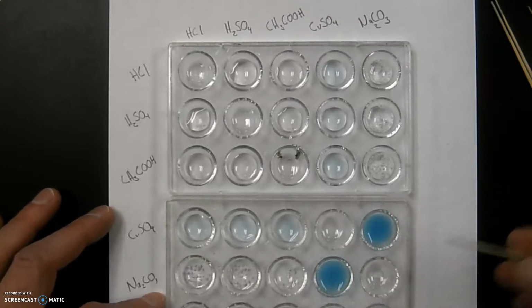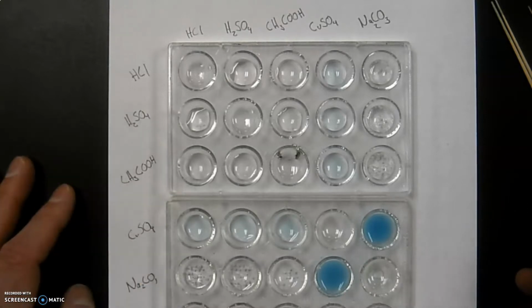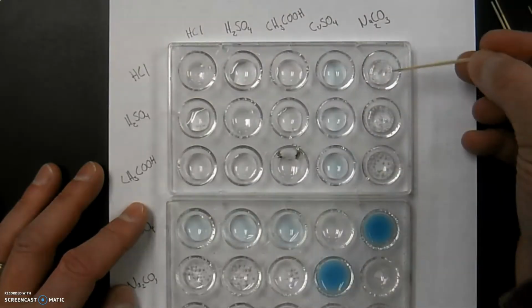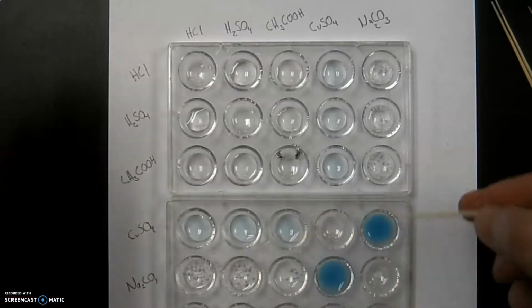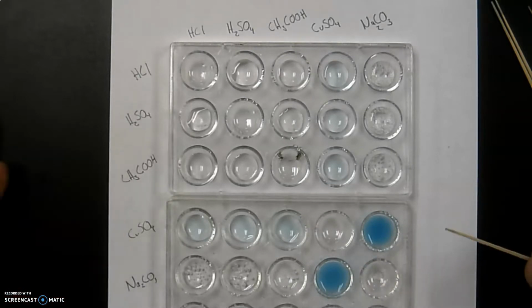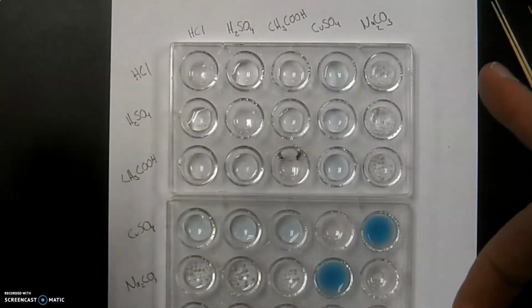Okay, so it looks like some of them are duds. Quite a few of them are duds as far as not seeing anything going on. Sometimes the color just diluted out that you're seeing in here. But it looks like we have some bubbles here, here, and some other places as well. And then you have some type of a precipitate happening in these two over there as far as some reactions with those.